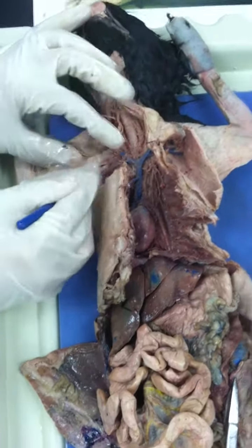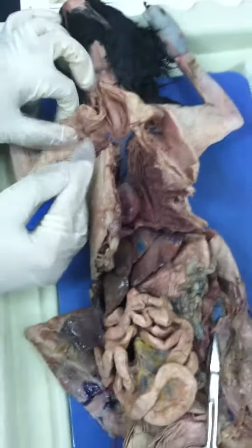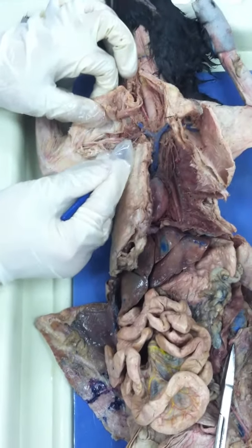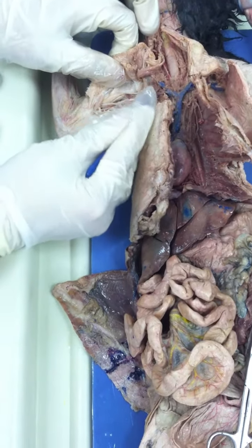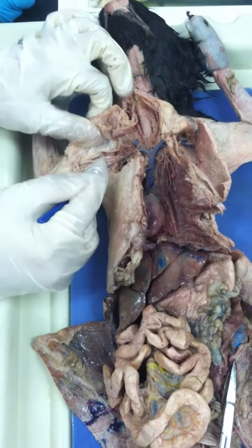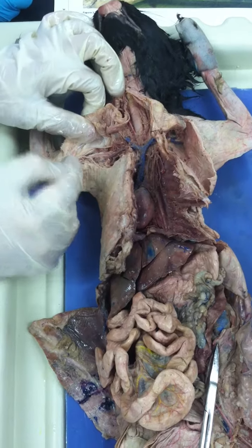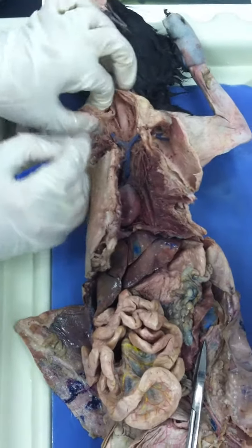Okay. Now, on top of that subclavian, you encountered the subscapular vein. You see it? So this is subscapular. This is subclavian. The white part is the subscapular? Or no? No, this one. That one. Oh, sorry. Okay. Subscapular and subclavian. And when it's here in the armpit, we call it axillary. And when it comes to the arm, brachial. Very good. Okay. So now we're going to continue.